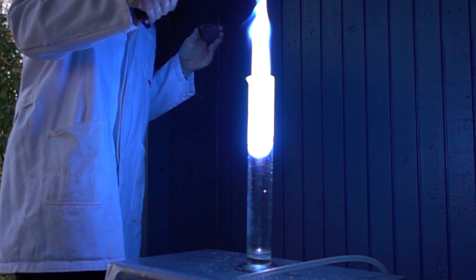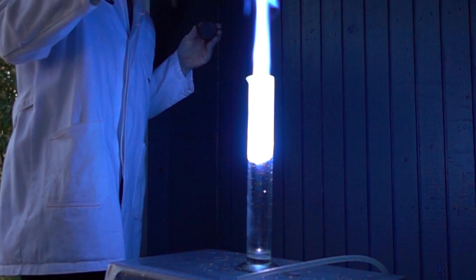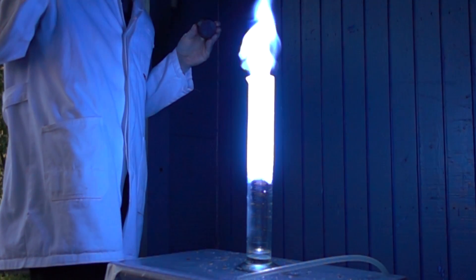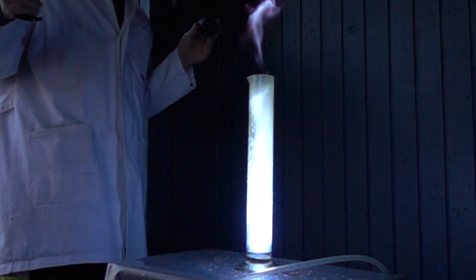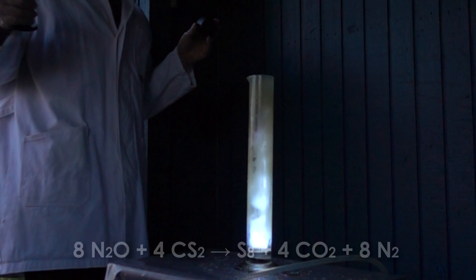The explosion wave reflects off the cylinder's bottom and is followed by another one. The reaction continues in waves until the end. Bright blue color is a result of the fluorescence of gases which appears in this reaction.